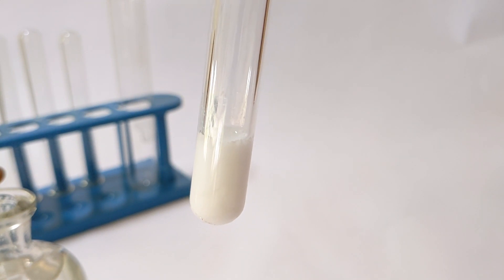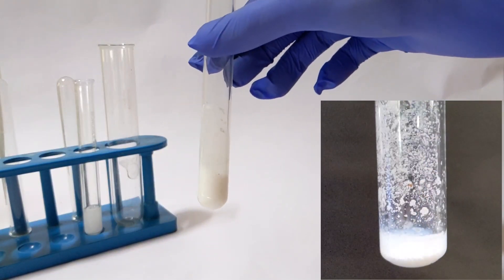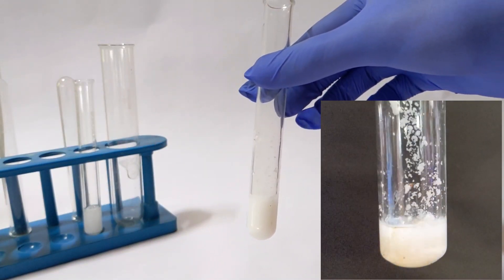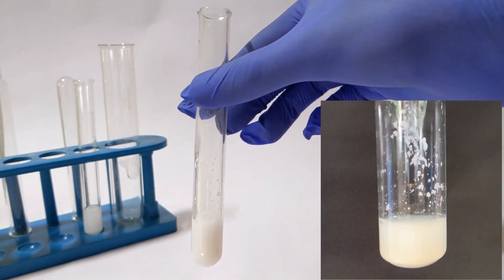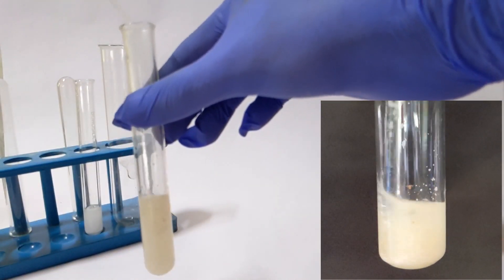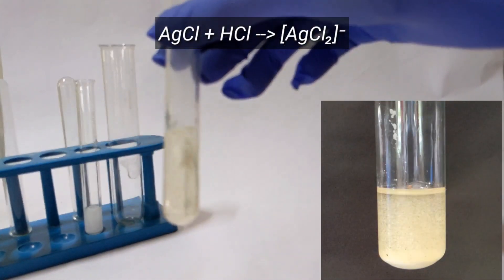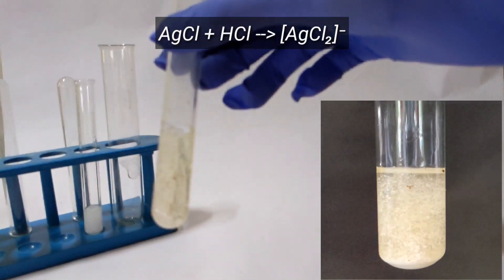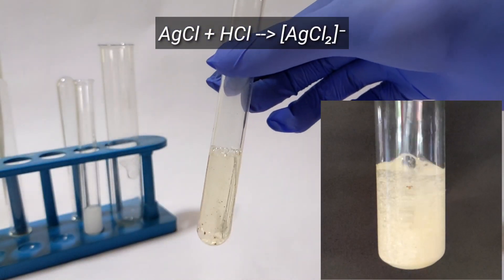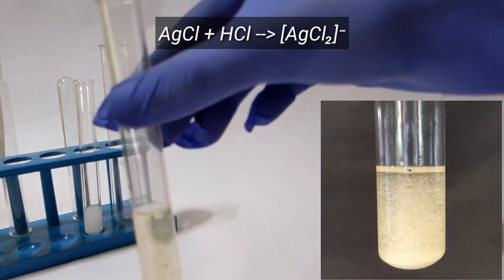Some amount of this precipitate was then taken in another test tube and concentrated 36% hydrochloric acid was added to it. You will notice how the silver chloride precipitate dissolves and the solution turns clear. What is happening here is that excess hydrochloric acid dissolves the silver chloride precipitate, forming a soluble dichloro-argentate complex.